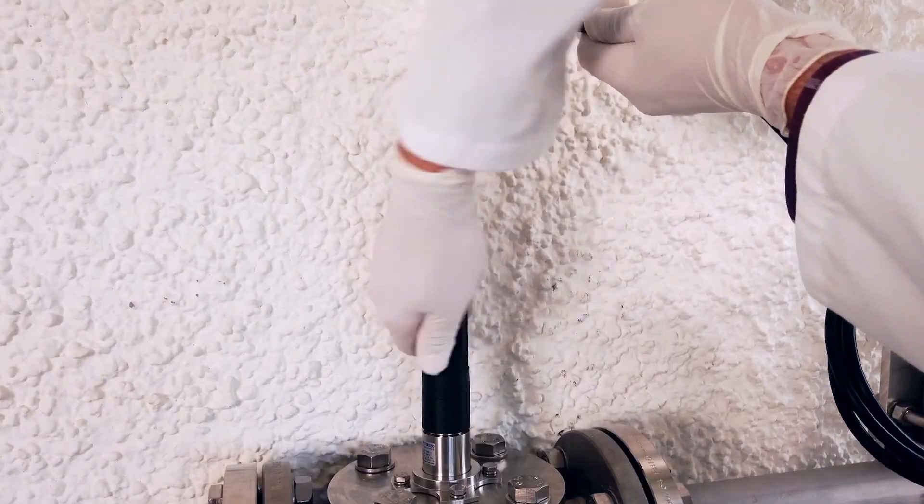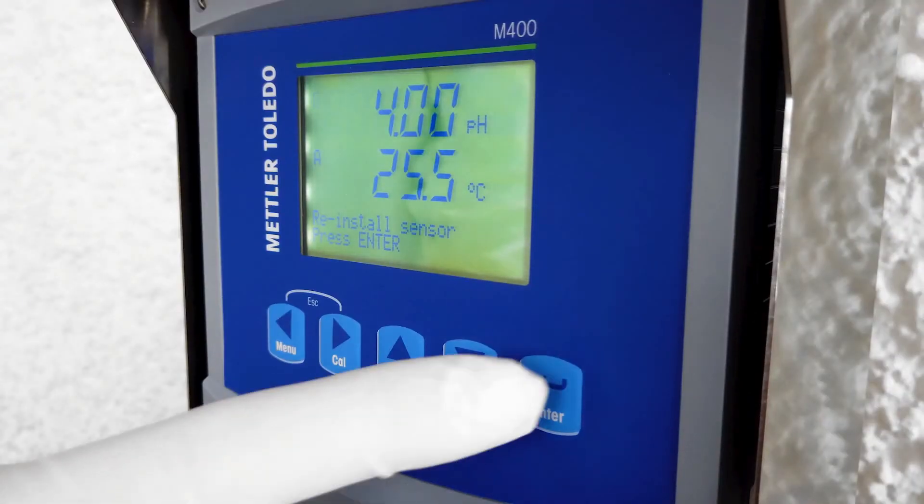Now your sensor is calibrated successfully.